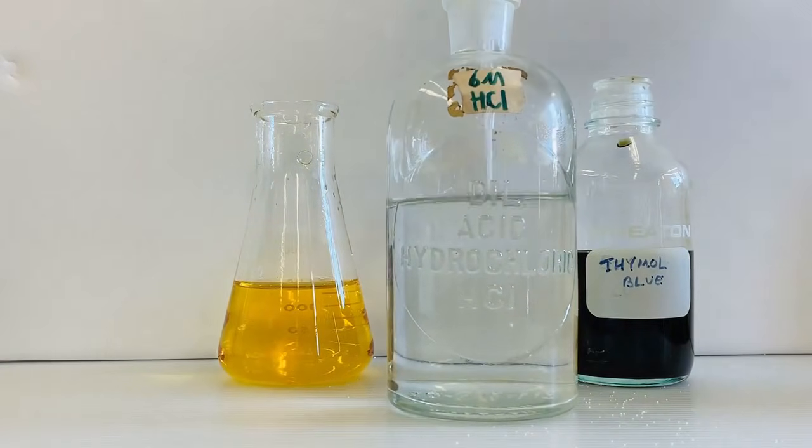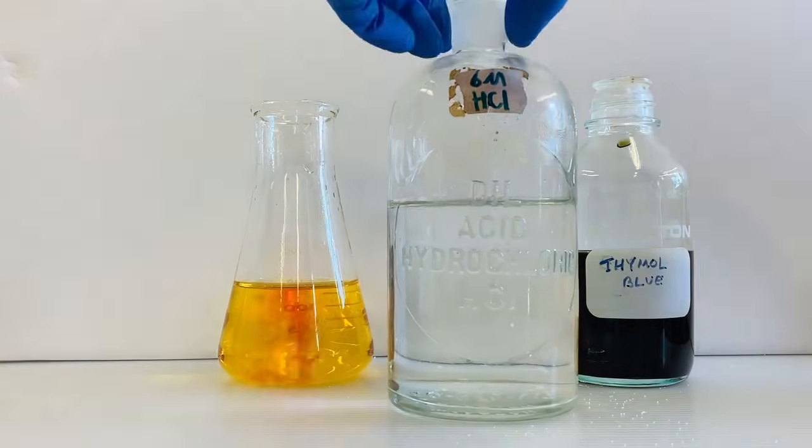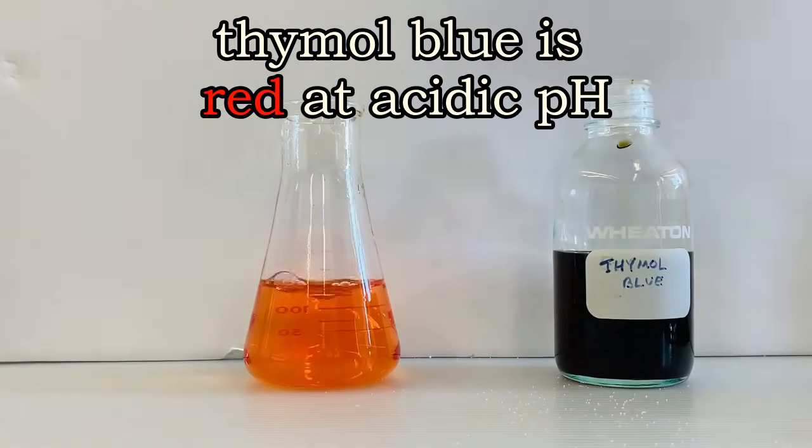Let's see what happens if we add a little bit of acid. It looks like thymol blue turns red in the presence of an acid.